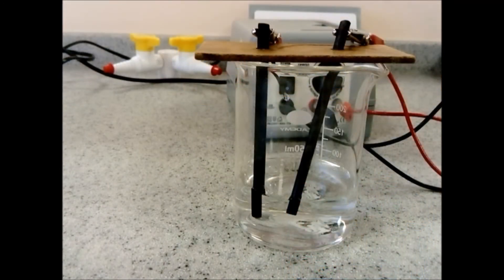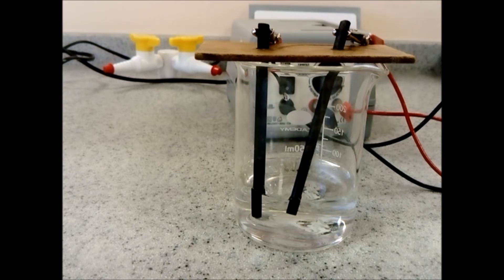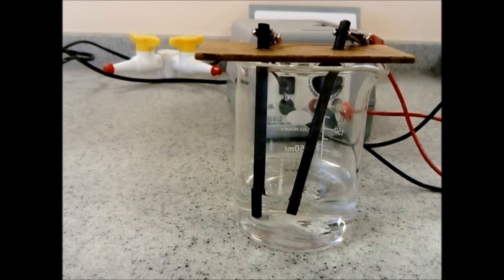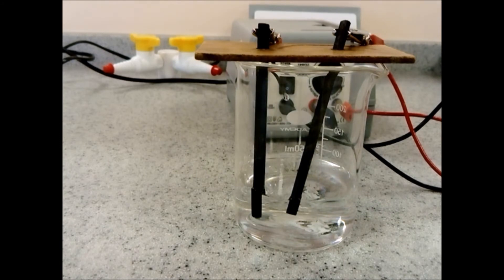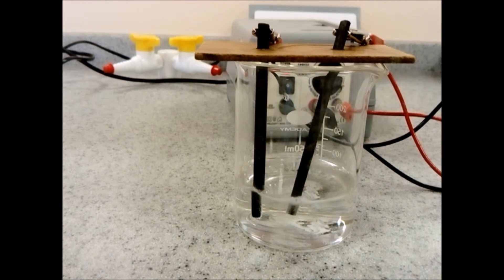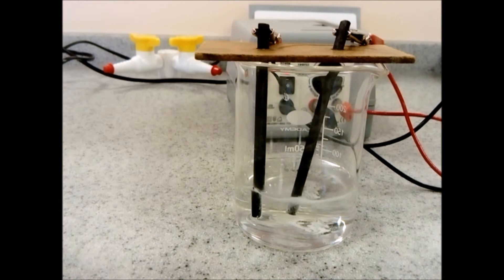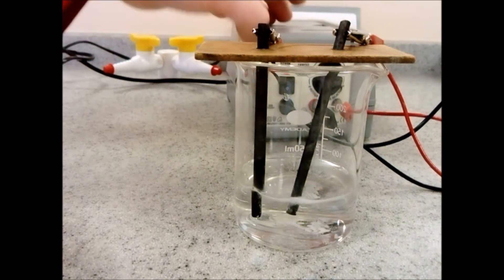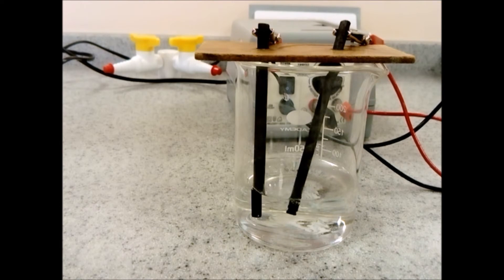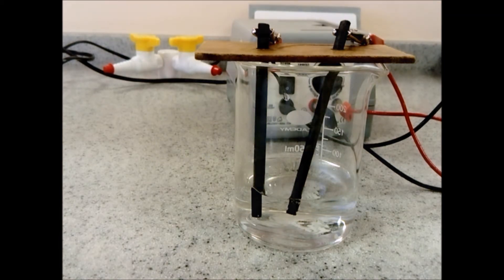Next we're going to electrolyze sodium chloride. Remember, when sodium chloride is dissolved in water we're technically forming brine. When we pass current through it we form positive sodium ions, negative chloride ions, positive hydrogen ions, and negative hydroxide ions. We're not going to leave it on for very long because we don't want to make chlorine. You can see lots of hydrogen at the negative electrode, a little bit of chlorine at the positive electrode, and left in solution you'll have sodium hydroxide where the Na⁺ ions ionically bond with the OH⁻ ions to form an alkali.